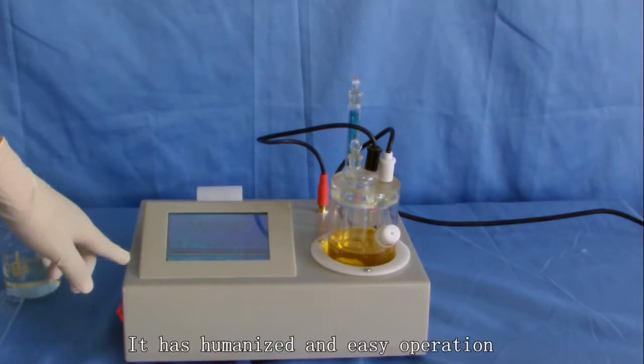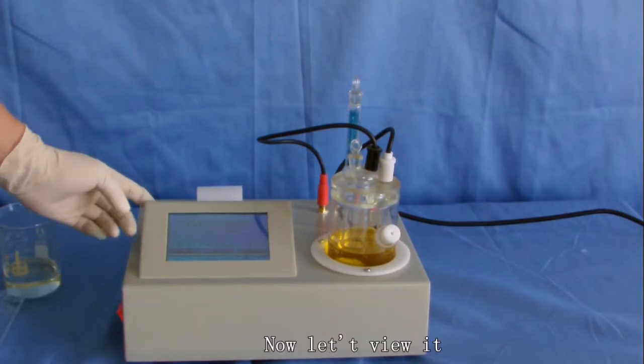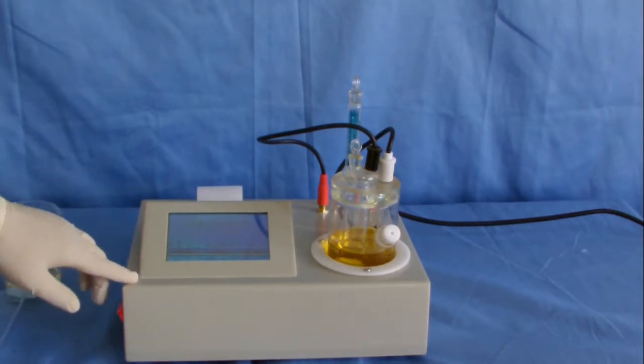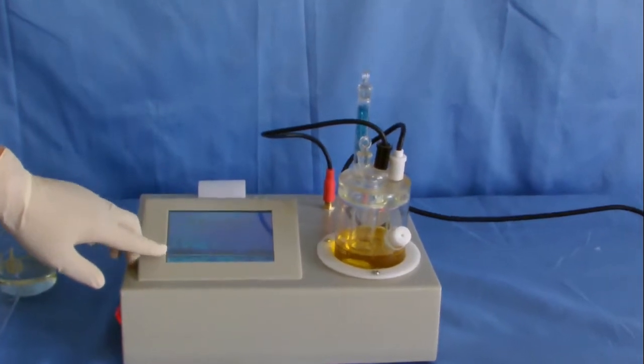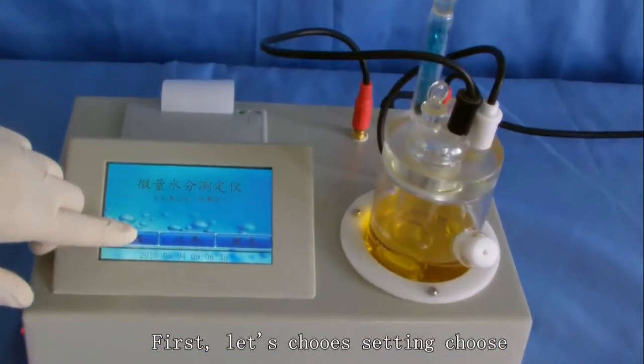It has humanized and easy operation, now let's view it. First, let's choose settings.